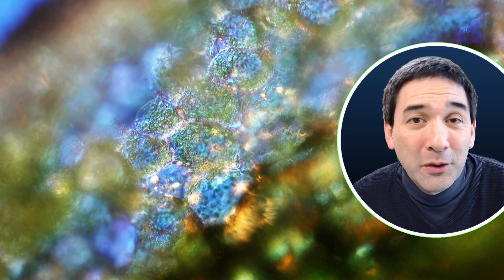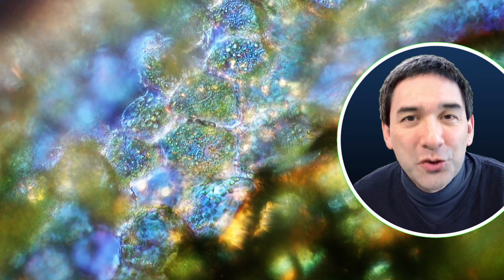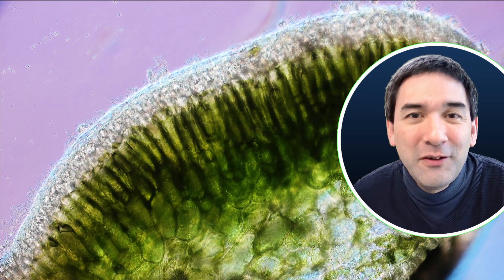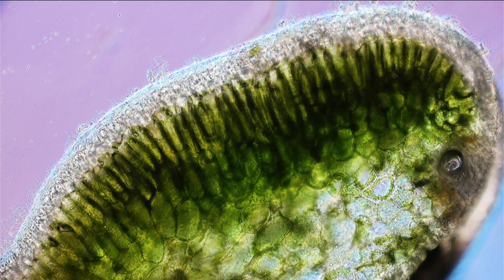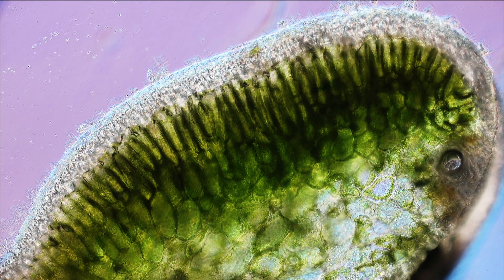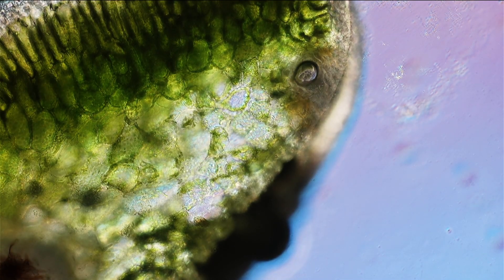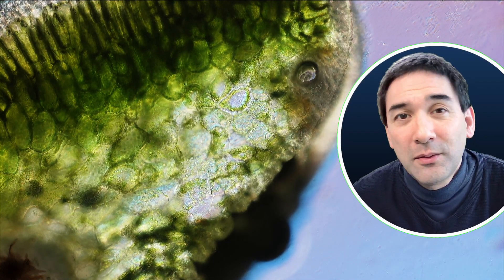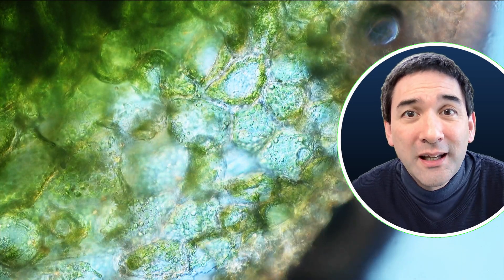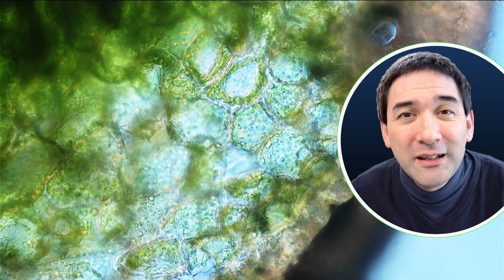I was able to find a small part in the cross-section which was sufficiently thin that I could actually look into the cells. These cells have those green dots in them — these are chloroplasts. In some other parts, the chloroplasts are so dense and the cells so tightly packed that it's very difficult to see the individual cells. If you look very carefully, the outermost surface on the top is actually white — almost transparent — because it's responsible for preventing loss of water. It's referred to as the epidermis, and these cells secrete a layer of wax, called the waxy cuticle, which prevents water loss.